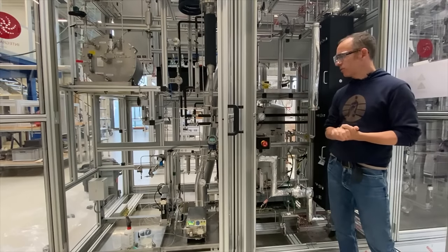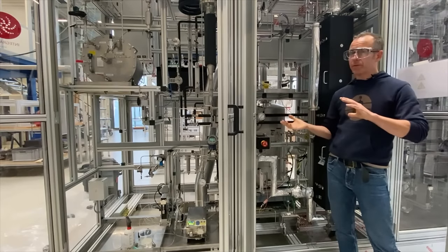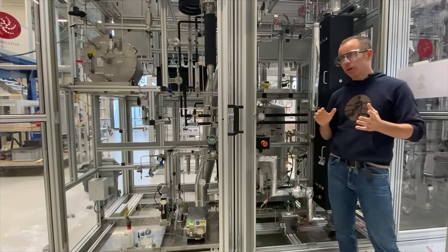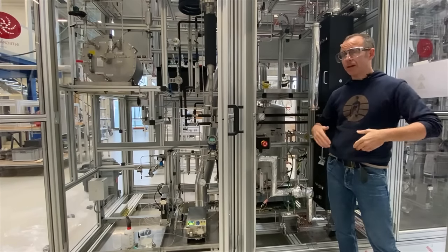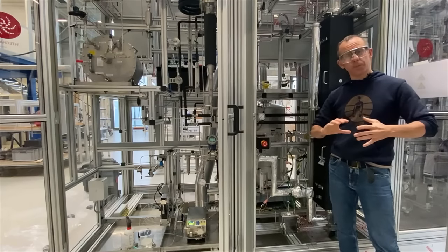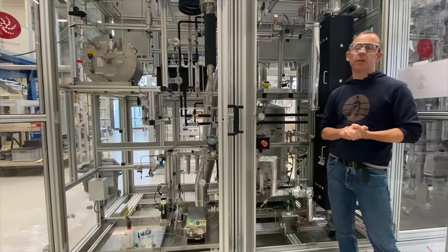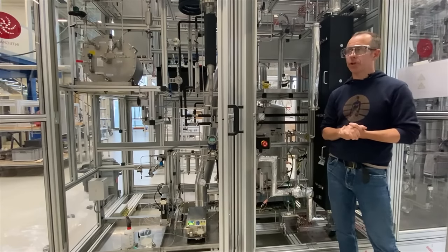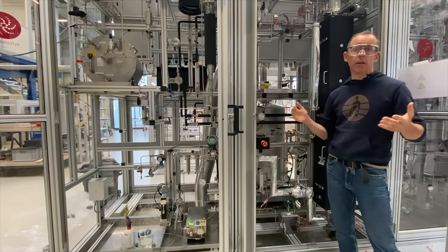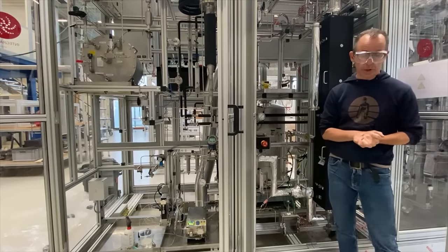The unit is especially designed to handle things like green oils, which often occur when going from the oxy-chlorination step back to the reaction itself. Because we're working with chlorine intermittently, HCl is being formed, which is why at the head of this unit — as you can see — we have a caustic stripper. This ensures that any chlorine or HCl evolved during the course of reaction or regeneration is effectively stripped from all of the off-gas, preventing it from accumulating in the ventilation system and ultimately causing issues such as corrosion.